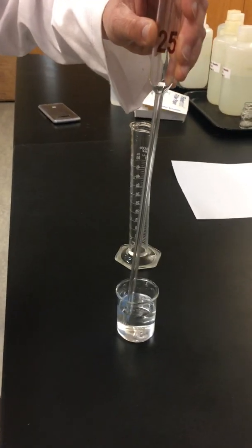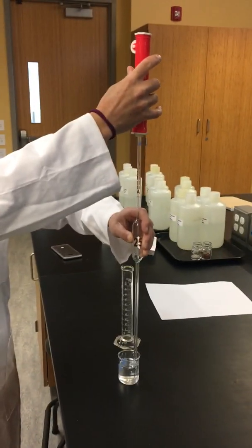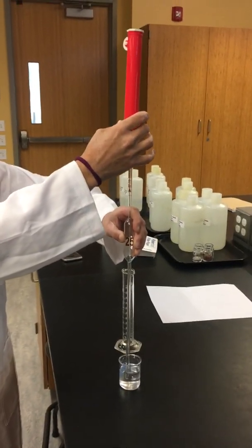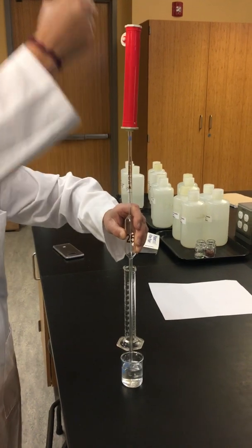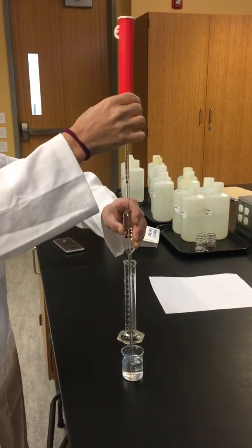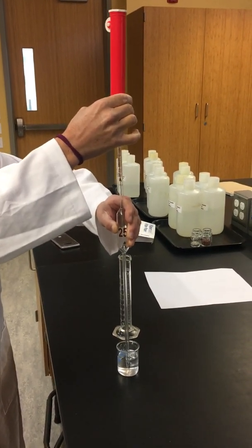We're going to place our pipette aid on the top of our volumetric pipette, but when we're doing this, we don't want to overforce it onto it. We're just lightly putting it on to where it stops.